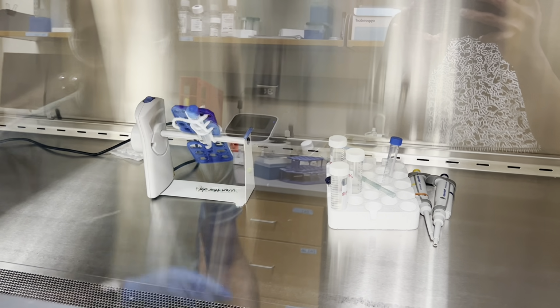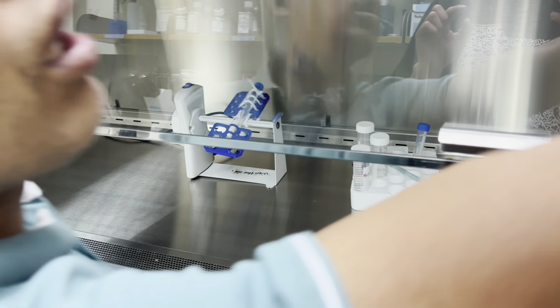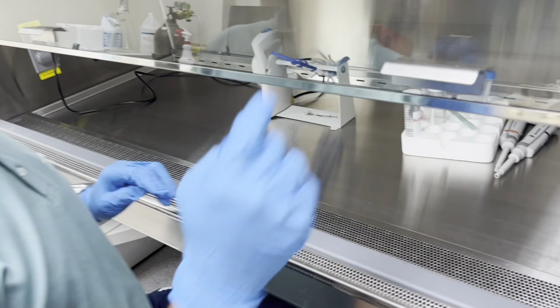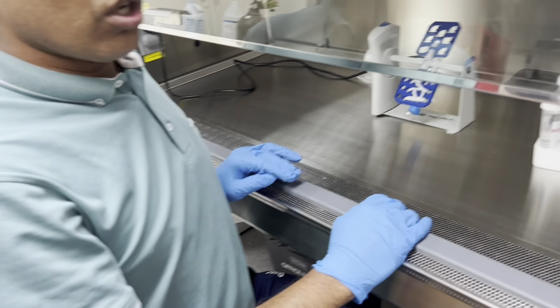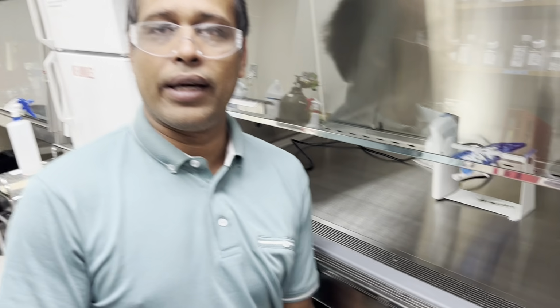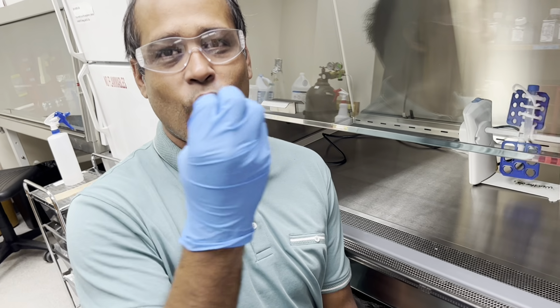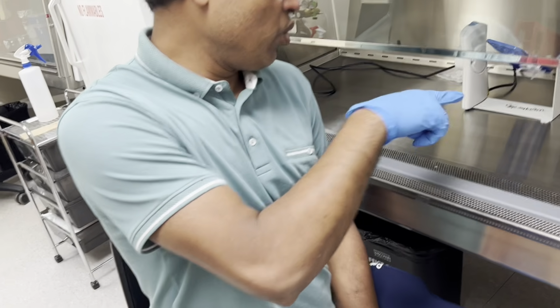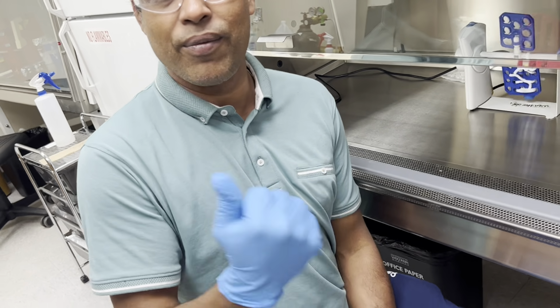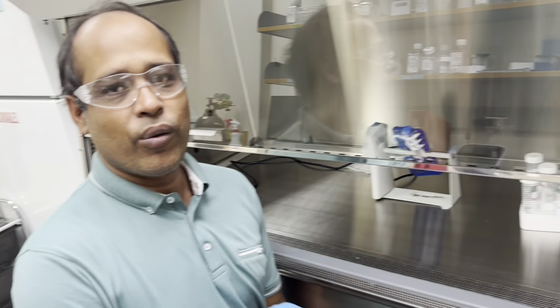Do you know why we are not using PBS now? I don't know if this is the exact reason, but we did want this to be slightly acidic, right? And then later on, you want it at biological pH, which is why you want to buffer it. That's correct. So the activation requires water only, but if you use the 1x PBS or 5x PBS, that will keep the pH at like 7.4. The point is to lock it there, right? That's why we made it acidic by using 1 molar HCl to lower the pH. So that's the issue, we are not using that.